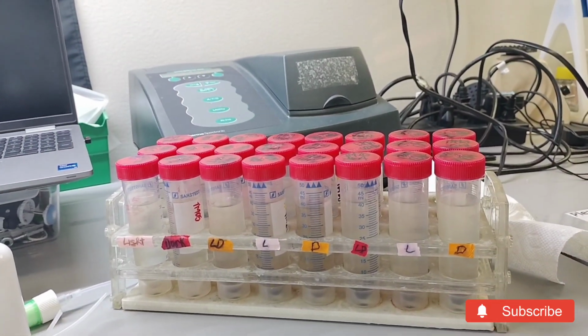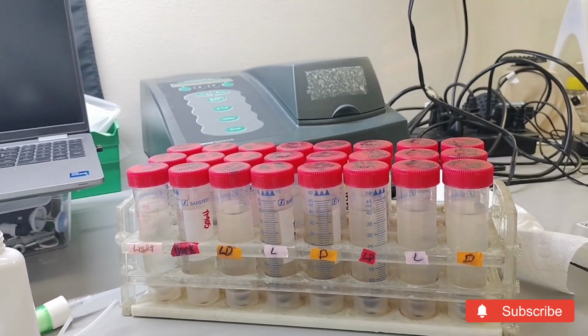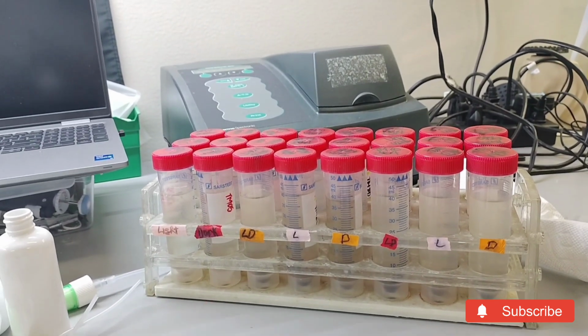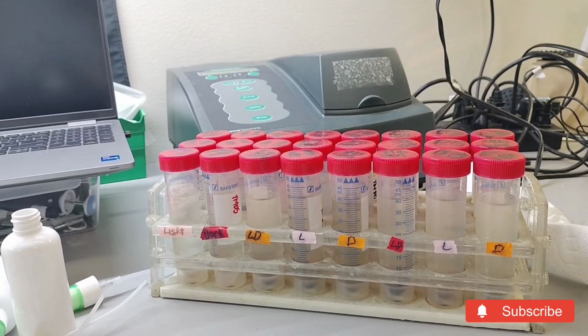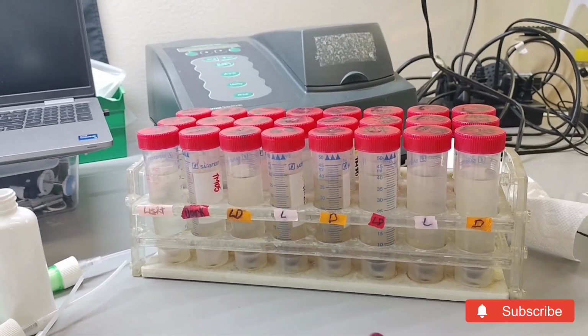I have identified which light conditions and which medium type or nutrition yields the highest number of spores based on the 3 fungal isolates, and go through the analysis of identifying which light conditions and which medium resulted in the highest spores by either of the 3 pathogens.